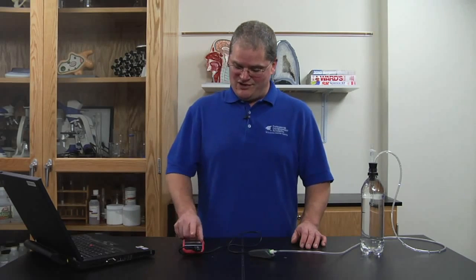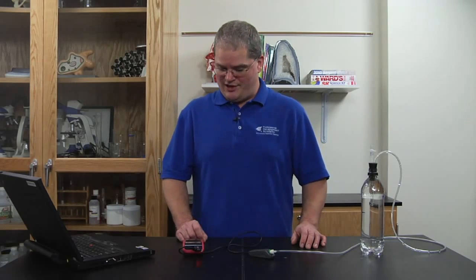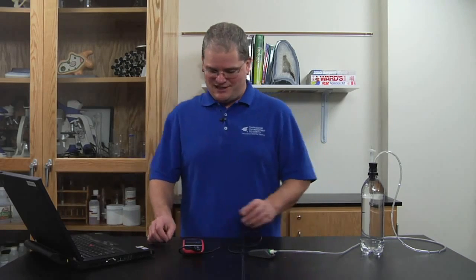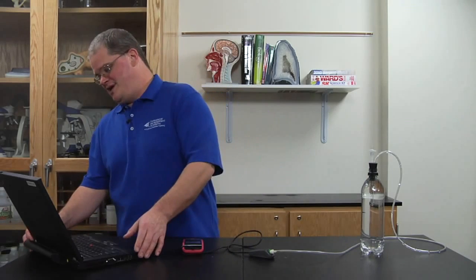So what I'm going to do is I'm going to now push the blue button, which will stop recording. You will see the USB icon flash blue while it's writing to the USB drive. Once it turns back to green, it's ready to take out and put into your computer.